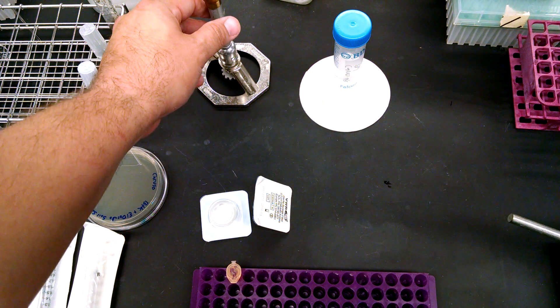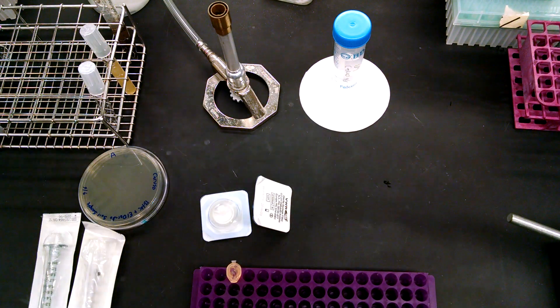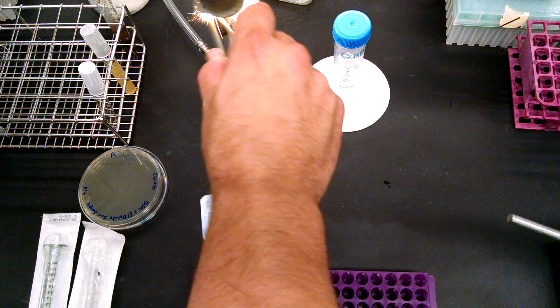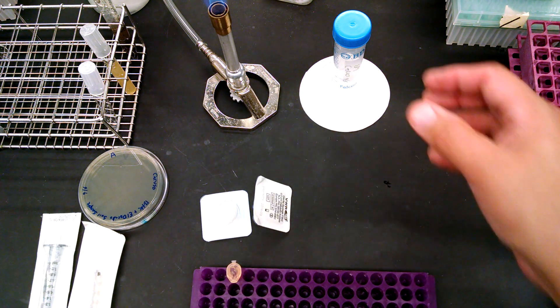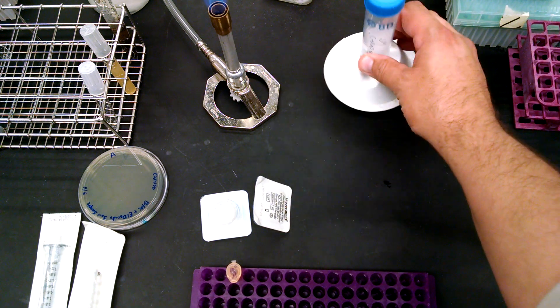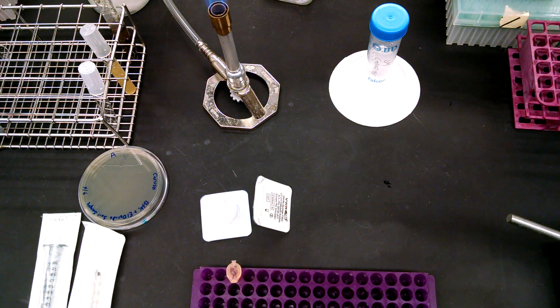So remember, like always, we need to work aseptically, so we're going to need to have a flame going. All right, so what we have here is some SM. Make sure you have nice clean SM.